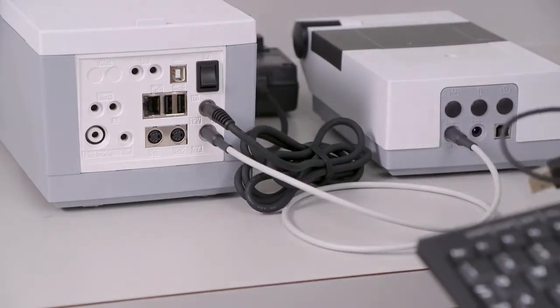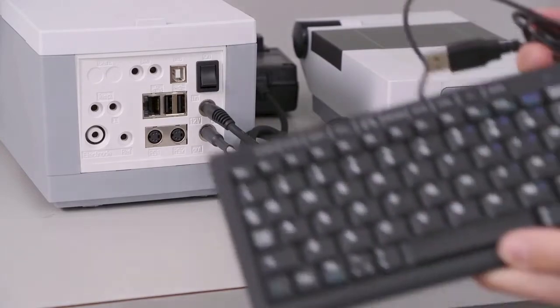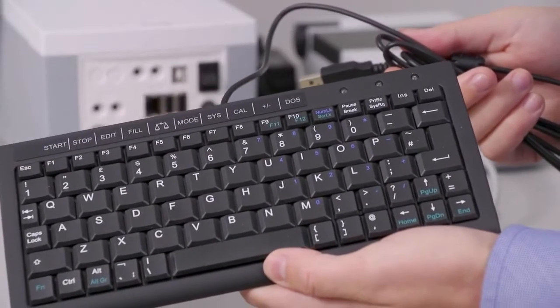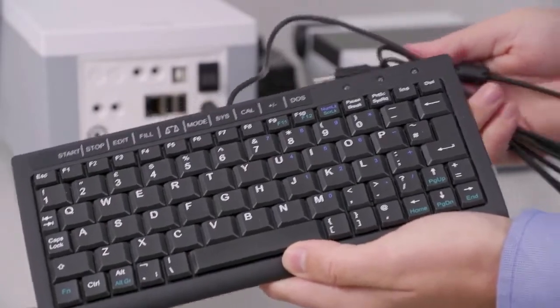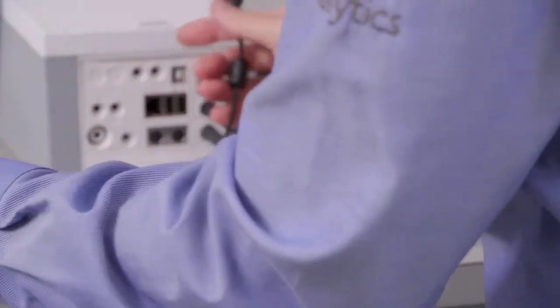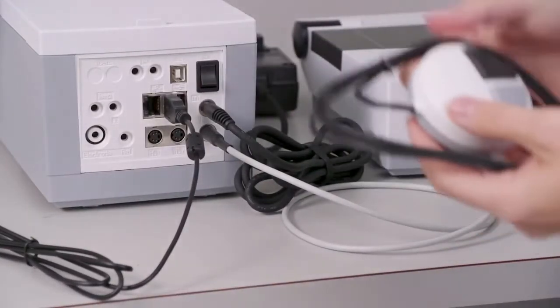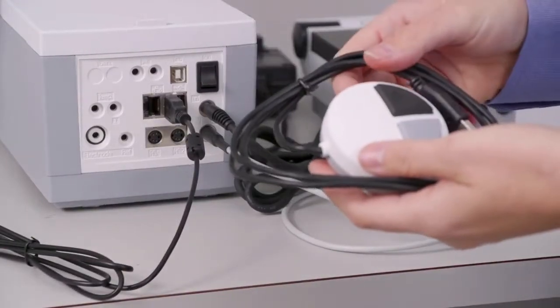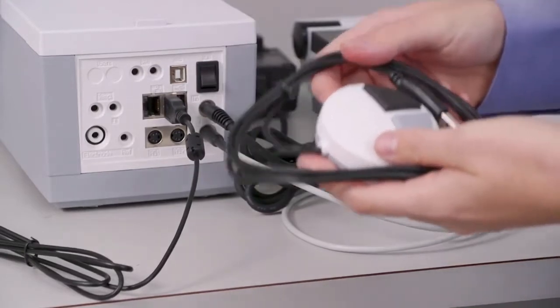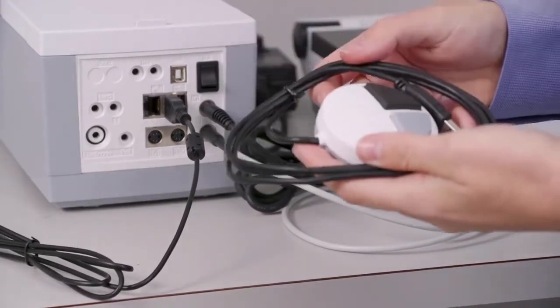Now is a good time to plug in any USB devices that you may have. One example is the mini keyboard that comes with all of our titrators. You can plug this into any of the USB ports that we have. A manual controlled mouse also comes with all of our units, but in this case we're actually going to skip it because we're going to be running auto titrations.